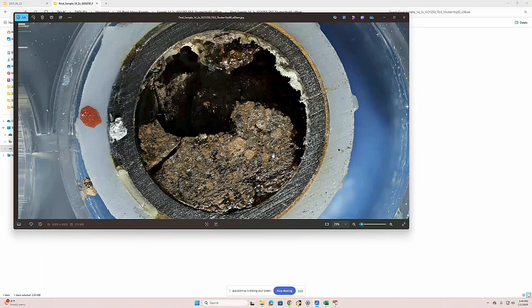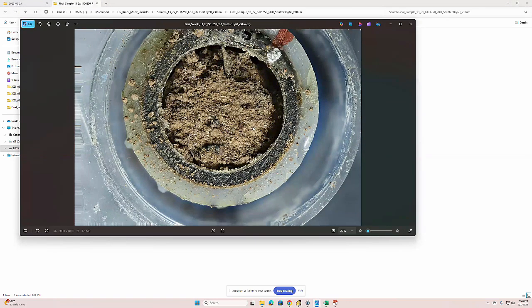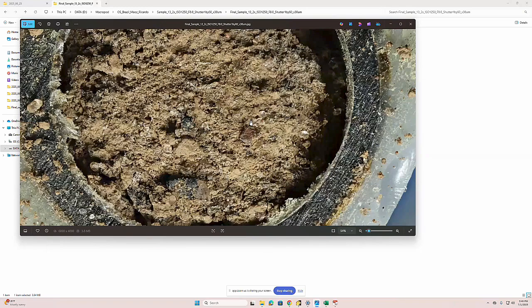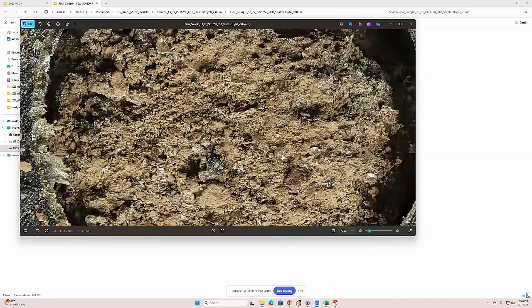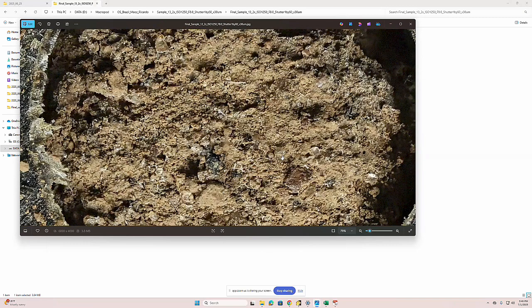Can I ask, are you using the flash? Okay, here's a different one. You're using the flash, right? Can you zoom in a little bit? Even this one, the lighting is still pretty poor. But you see how it's pretty blurry even when you start zooming in like that. That could be a couple things, but let's troubleshoot this one by one.